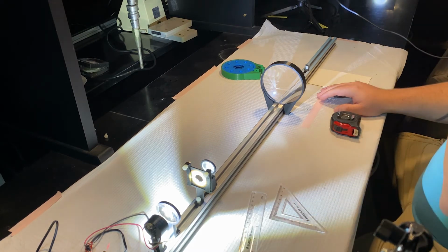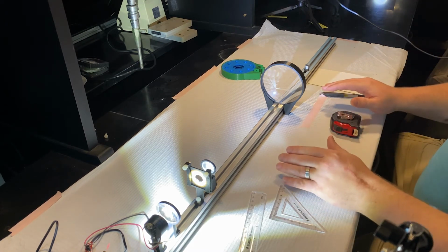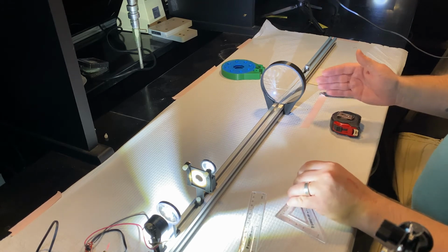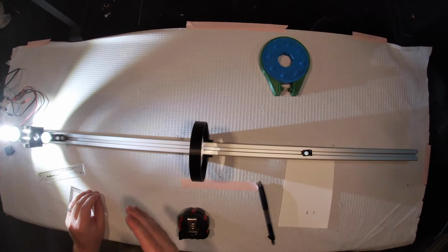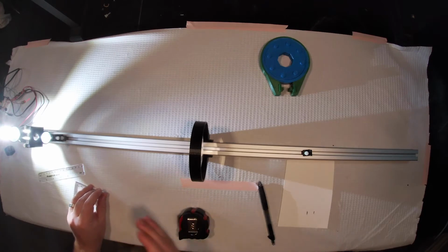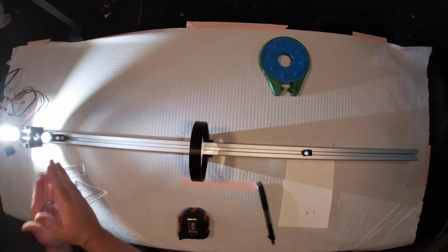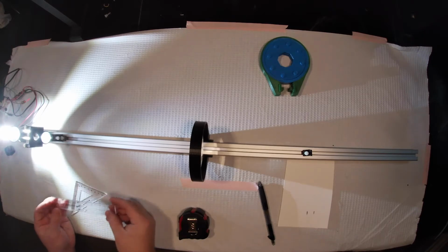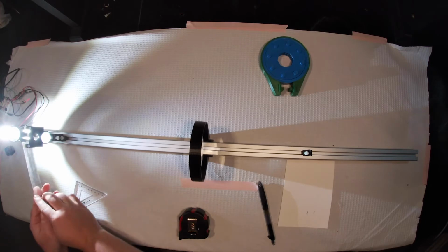Now in this lab, we're going to be complicating things slightly. We're going to be adding a second lens to our system. We're actually going to be making, in the first part at least, an infinity corrected system. So, as you learned in class, the infinity corrected system mandates that you put your objective lens one focal length away from your sample. So that's the first thing that we're going to be doing, is mounting our sample.